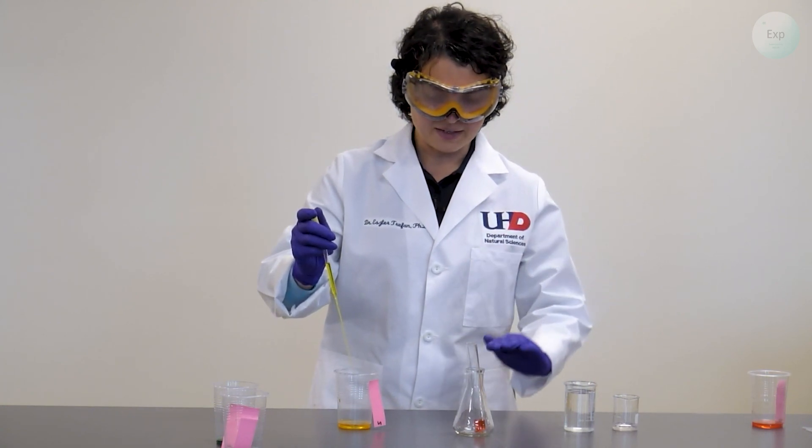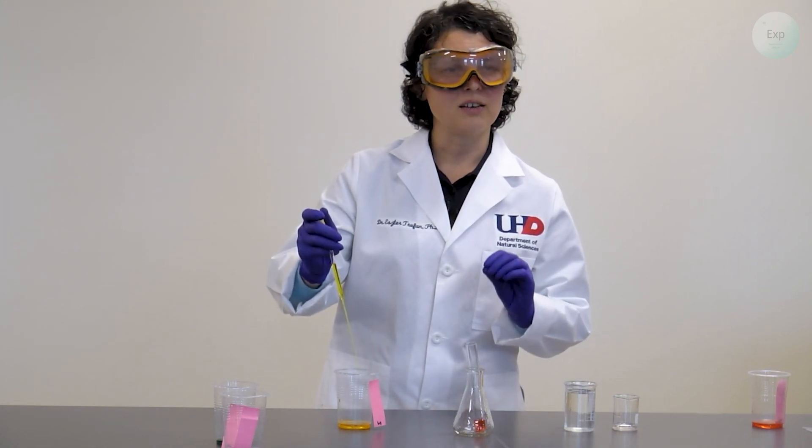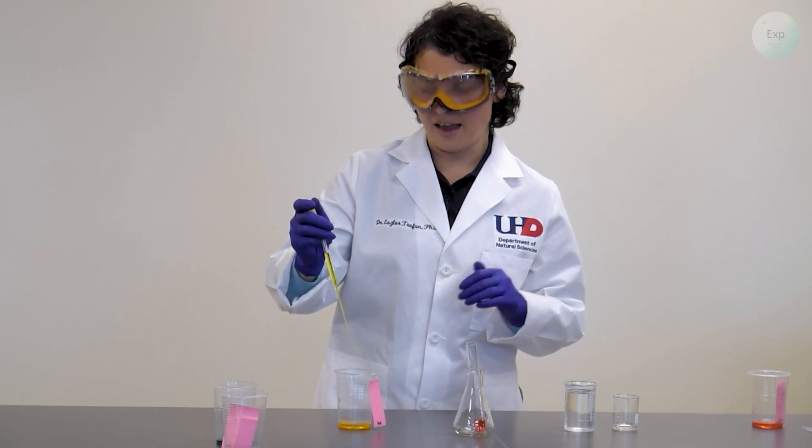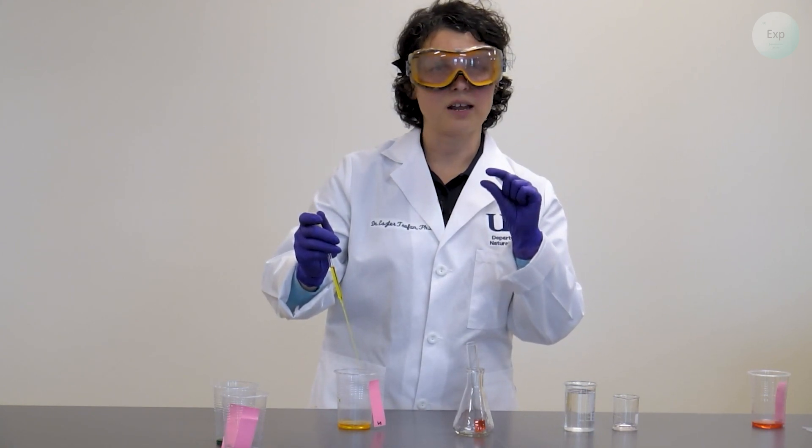So I will lower myself to eye level with my solution and then very gently drop wise I'm going to add the yellow layer until I see a clear separation between the red and the yellow layers.